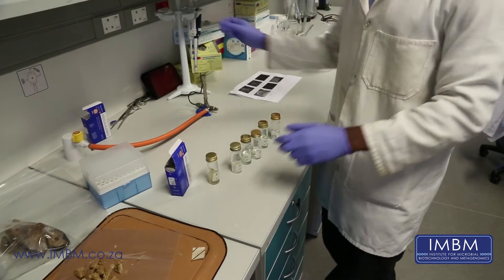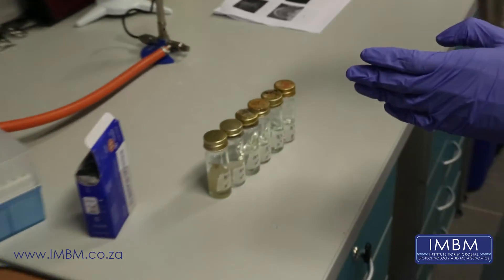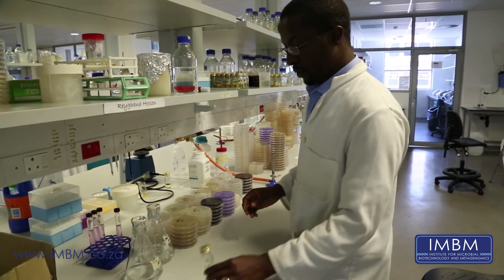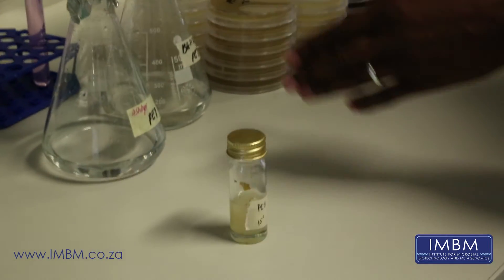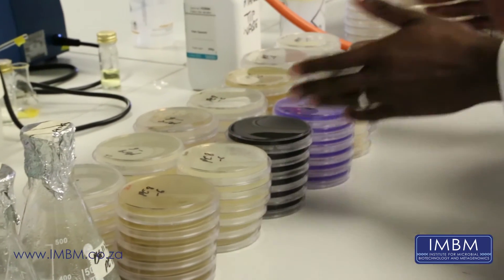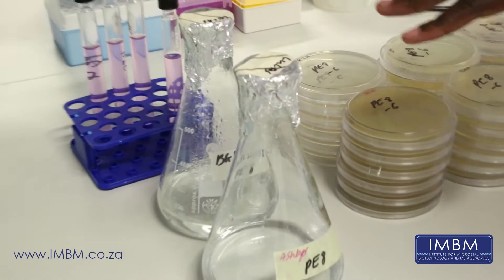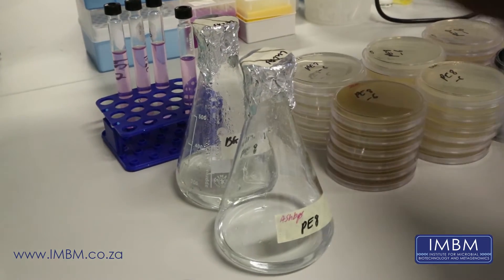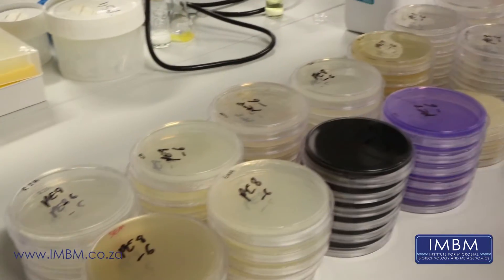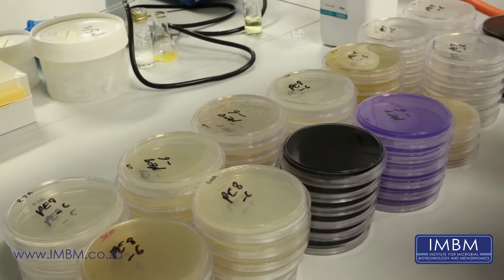At this stage we've prepared our seawater dilutions of our sponge extracts. We're going to proceed to inoculate 100 microliters of each dilution onto an agar plate — taking 100 microliters of solution from each vial and placing it on a particular agar plate. We have quite a number of different agar plates and media. These two flasks contain liquid media specific for photosynthetic bacteria. The different agar plates labeled R2A, SEM, ZB, and so on are general agar media for a diverse range of bacterial species.